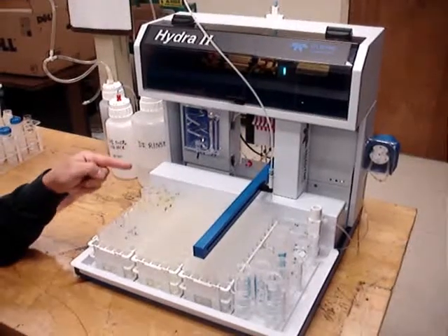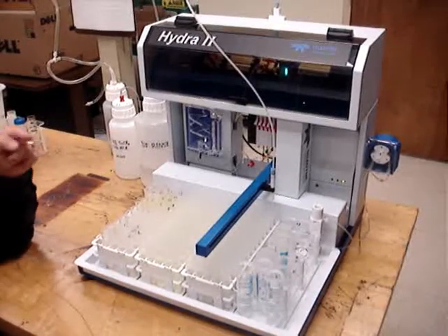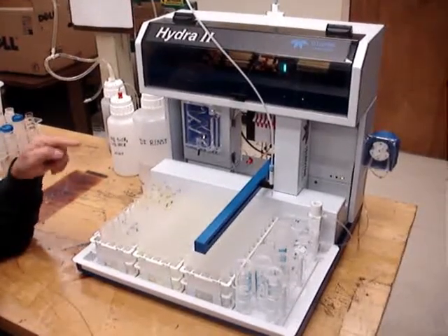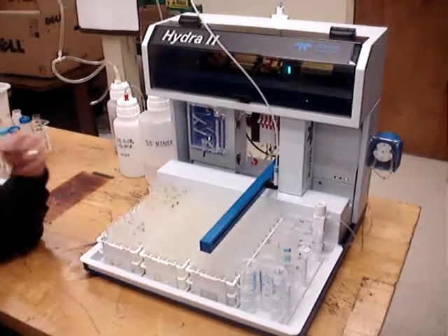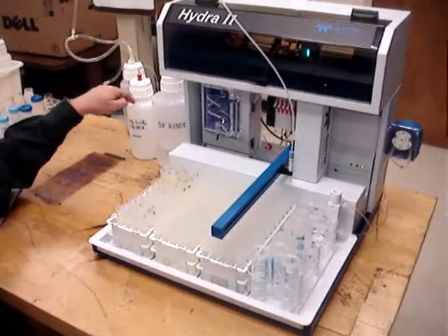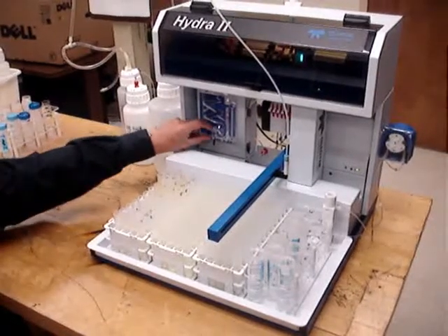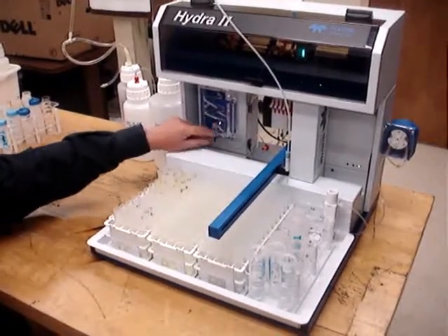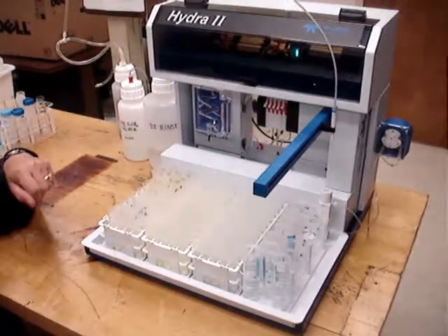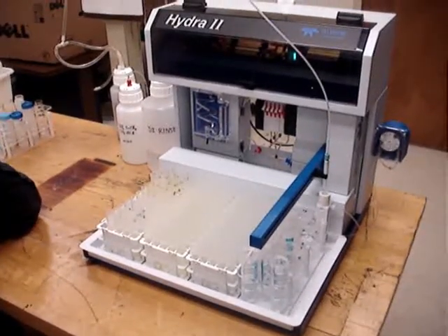The sample cycle starts with the rinse section itself. Now let's move to the sample. You'll notice that the peristaltic pump filling the rinse station is now stopped as the probe is in the sample solution. It's bringing the sample solution up through the peristaltic pump, mixing it with reducing agent, bringing it into the gas-liquid separator, filling the reaction cell, and bubbling in argon through the solution. At the end of analysis, it returns to the home position and starts rinsing again.